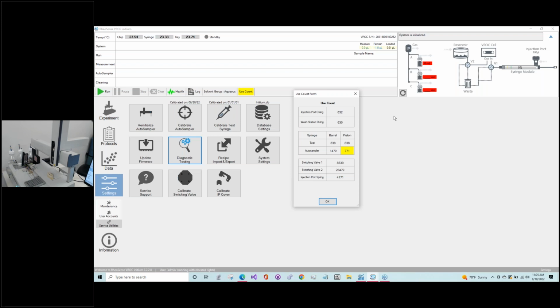So now I'm going to step aside, and Marina's going to talk about how easy it is and what tools you need, which should be supplied to you, for taking out the test syringe piston. And one of the things that we'll follow up with is that anytime you change either the piston or the barrel or both, you will need to do a calibration of this test syringe so that all the positioning is appropriate during testing and loading. And we'll cover that too, so that you understand how that goes.